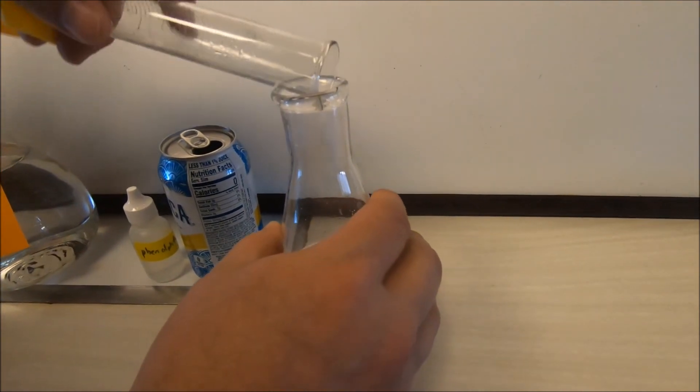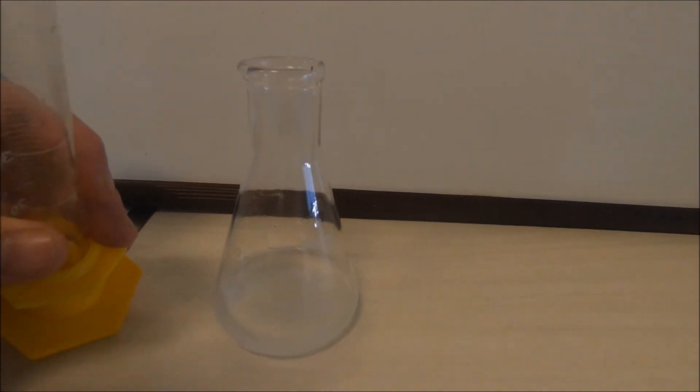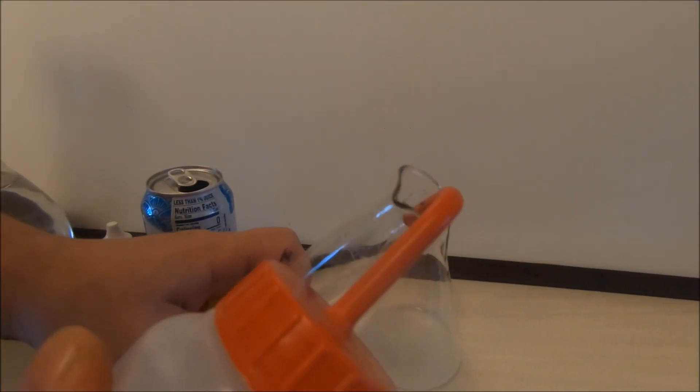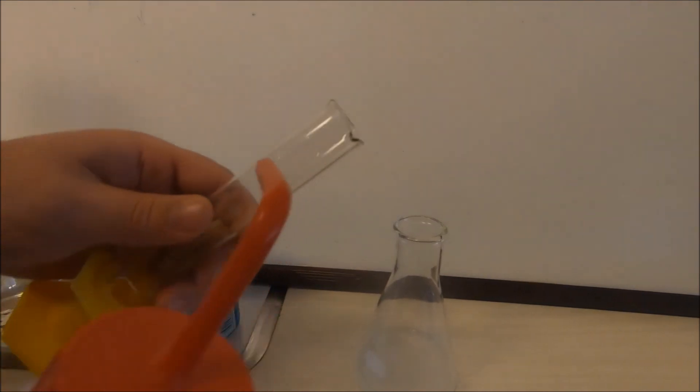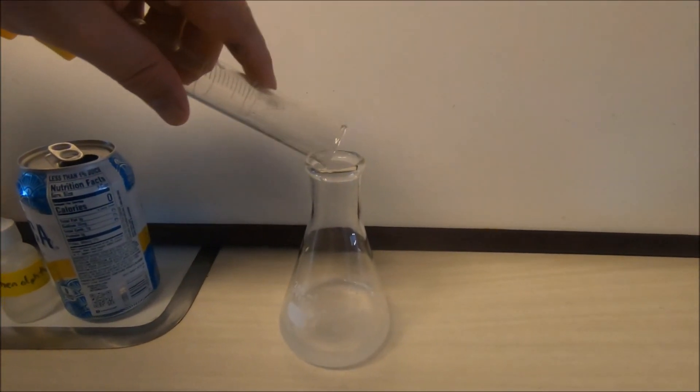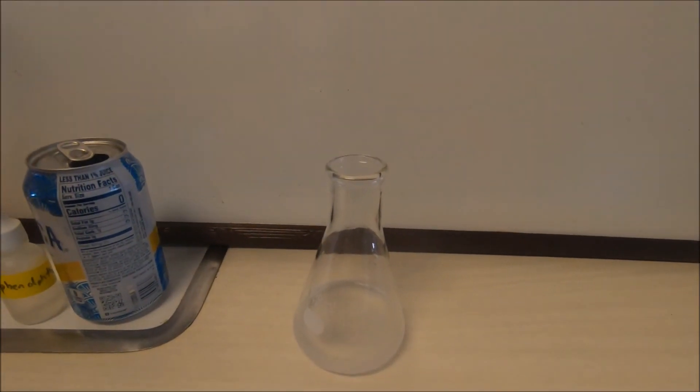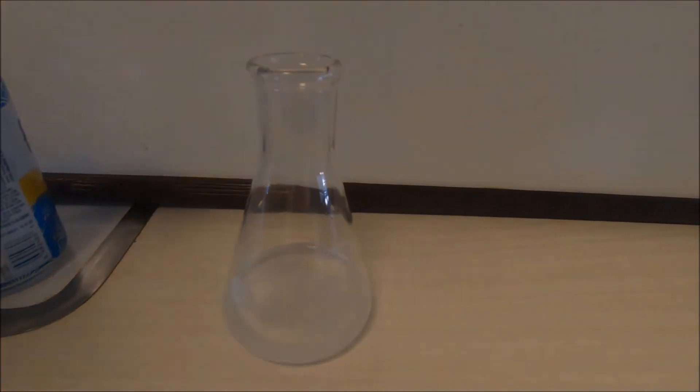Now that we've got that in the Erlenmeyer flask, we're going to then do a little rinse to make sure that we've got all of the soda in there. The extra water, since it doesn't contain any acid, is not going to change our results there.